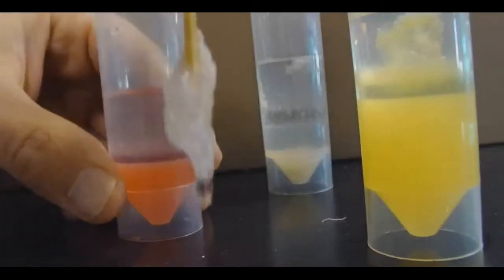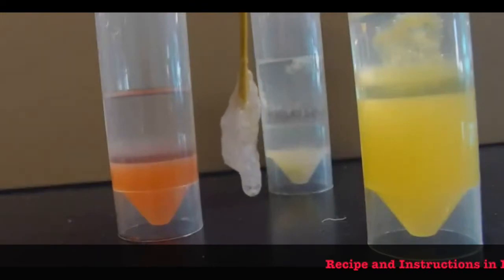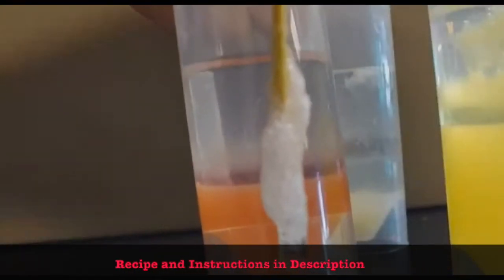What's going on everybody? It's Dr. Weaver here with another lab review, and this time I'm going to be showing you guys how to isolate DNA from any living thing using household ingredients.